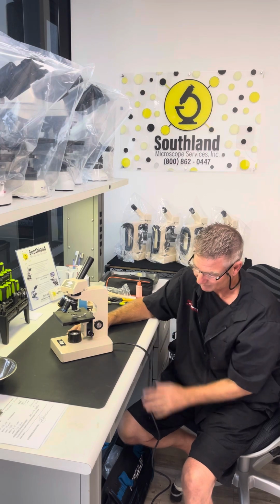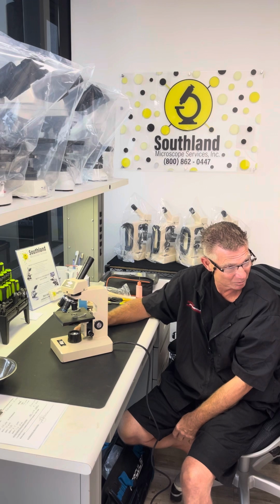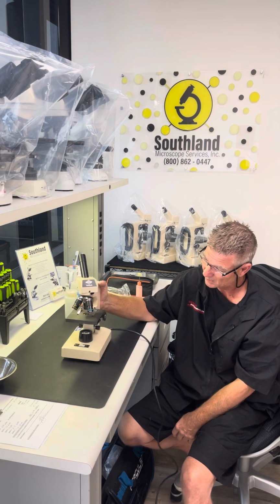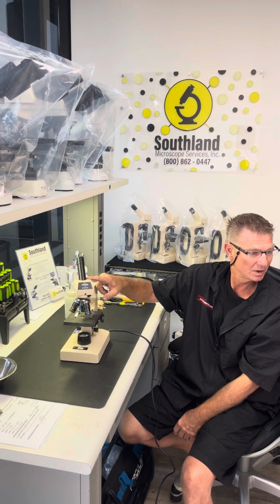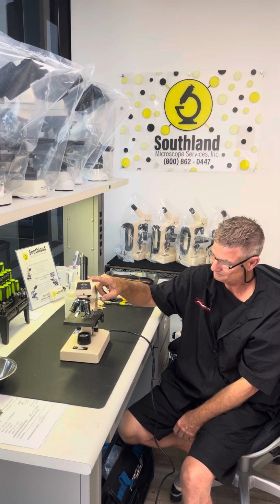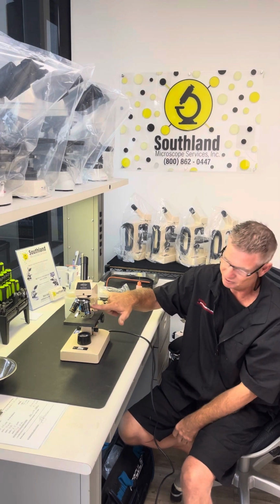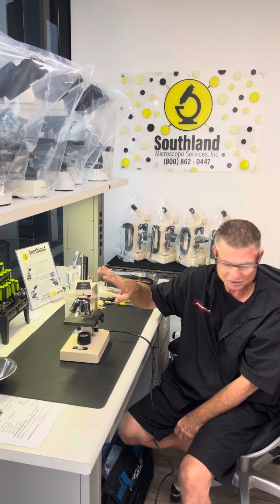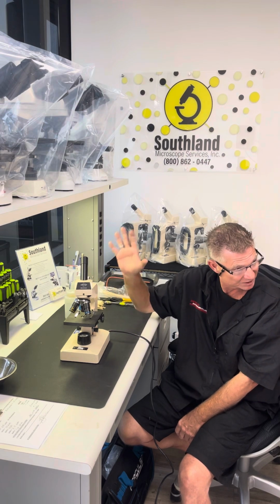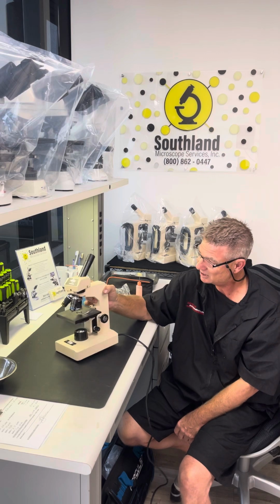The third component is the electrical. In the base we have lighting. We have the circuit board in here, we have different bulbs to create the lighting. The lighting in conjunction with the optics is how we see it. So the way the light comes through the objectives is how clear we can see it. So it's the lighting through the objectives which is the design of the microscope. We don't need to worry about all that big stuff right now.